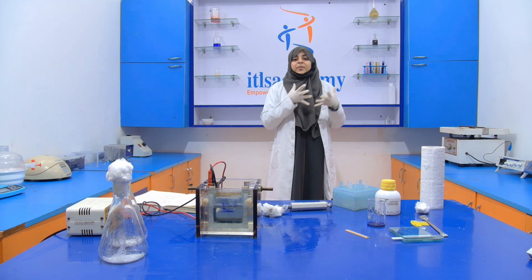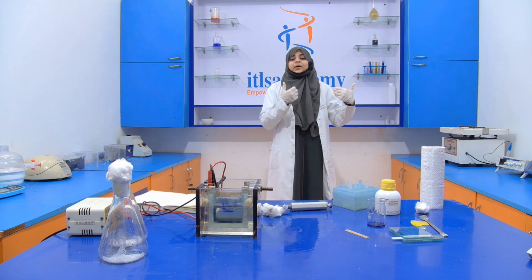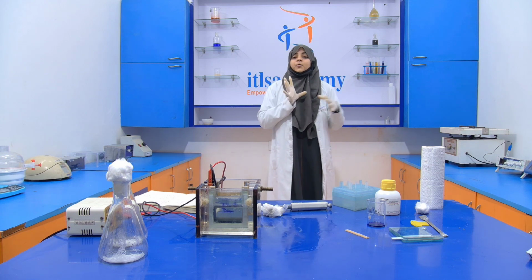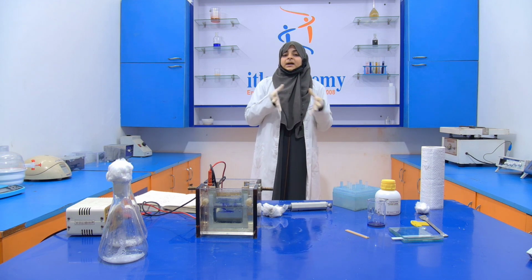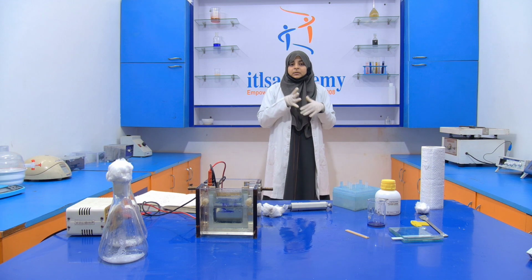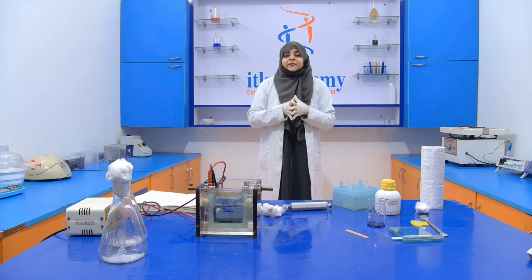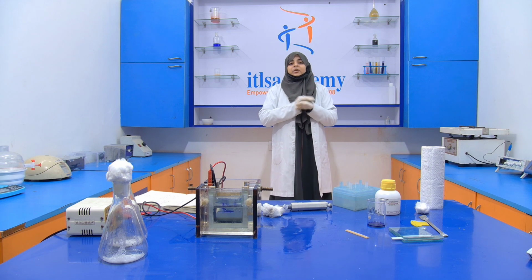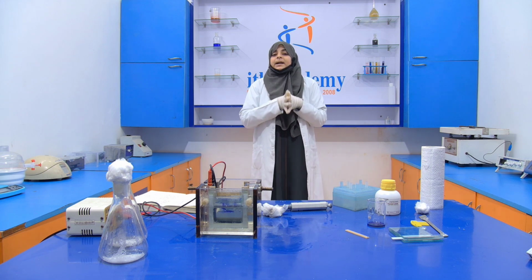It takes around 30 minutes for the solidification of one gel, and then again we pour another gel, and again it takes 30 minutes for the solidification. Everything we performed in this experiment, I already told you. I hope you will understand.